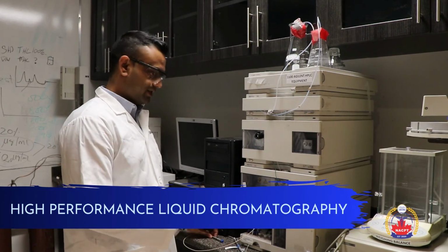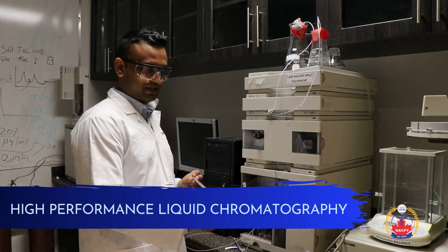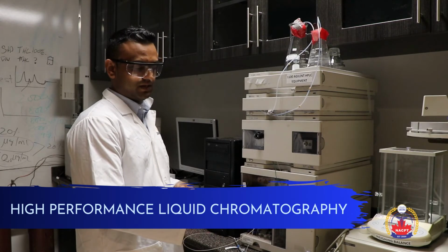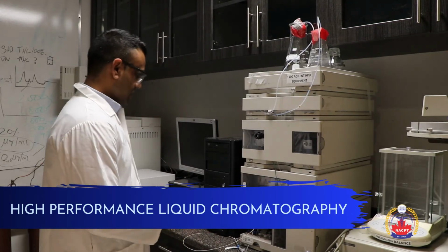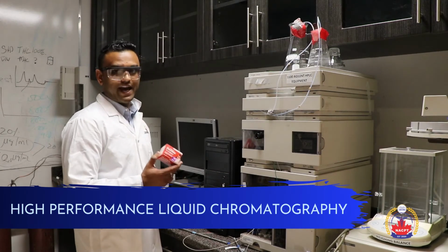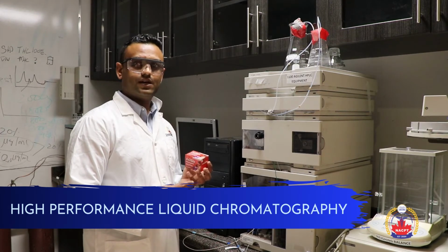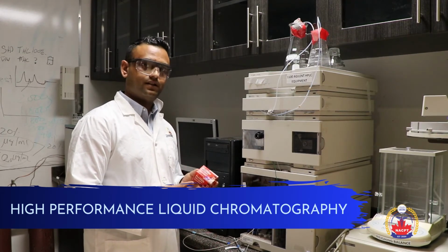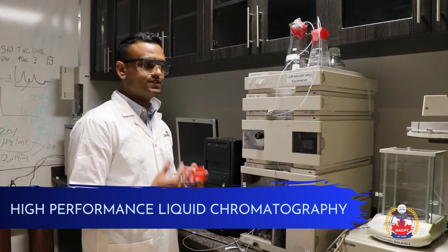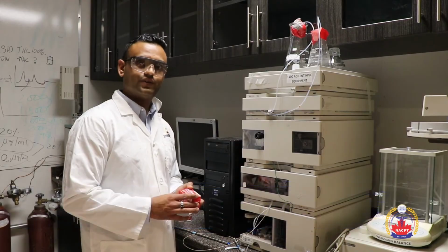We are looking at several types of columns. We have this column that is used for routine testing. It's the longest type of column, 300 millimeter. For the pharmaceutical program, we do assay analysis, content uniformity analysis, as well as related substance analysis using Tylenol tablets. We have a lab procedure that allows students to do this testing during their training.